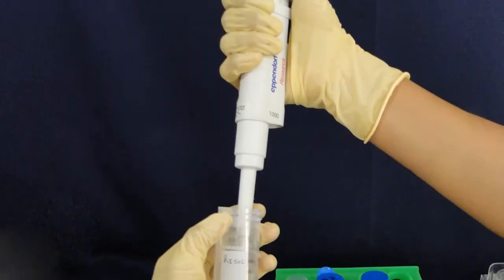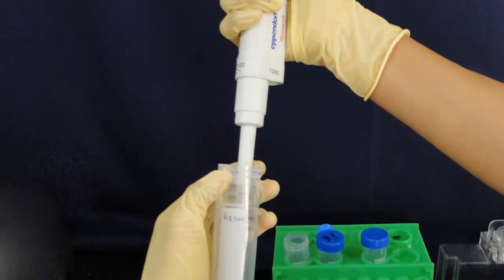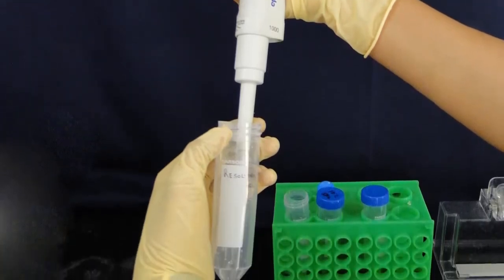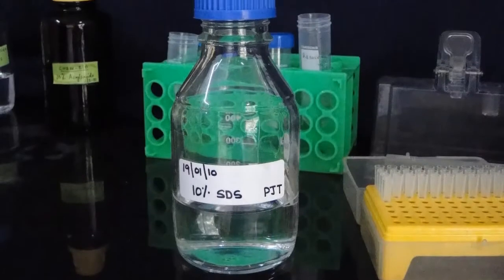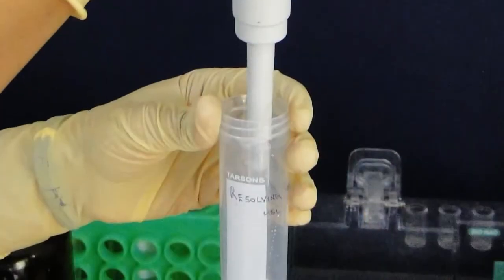Now prepare the 10% resolving or separating gel and 4.5% stacking gel solution by combining all the reagents except ammonium persulfate or APS and TEMED.